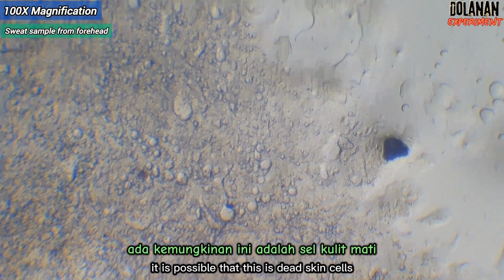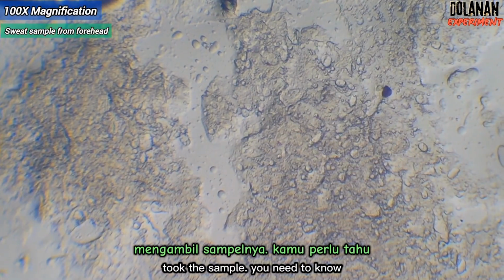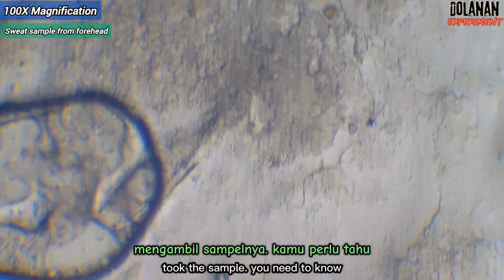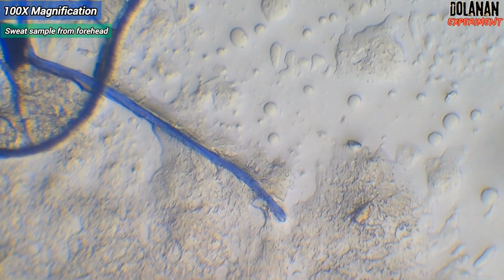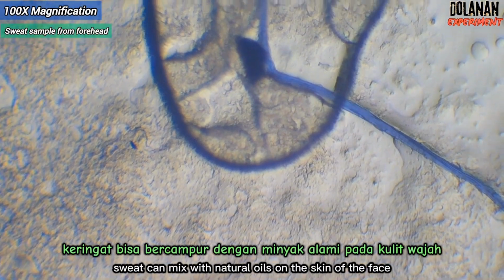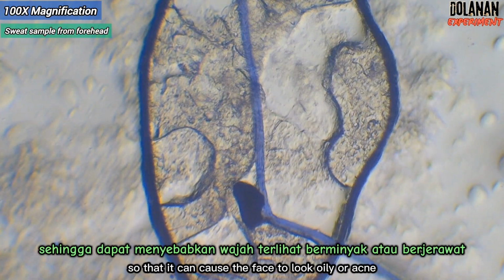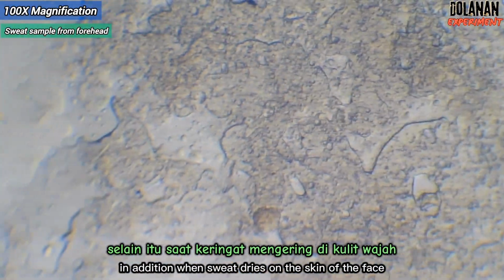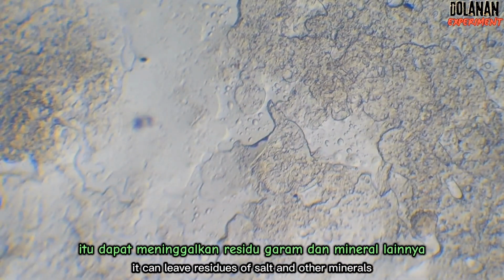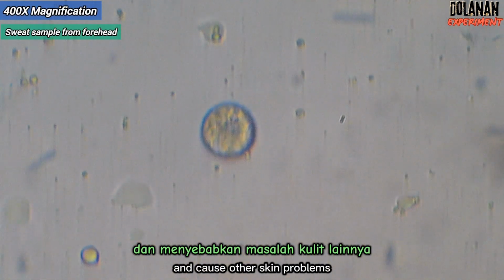It is possible that this is dead skin cells or oil from the face that was carried along when Mr. Bendel took the sample. You need to know, sweat does not directly cause oily face. However, sweat can mix with natural oils on the skin of the face, such as sebum, and other dirt, so that it can cause the face to look oily or acne. In addition, when sweat dries on the skin of the face, it can leave residues of salt and other minerals that can affect the balance of the skin and cause other skin problems.